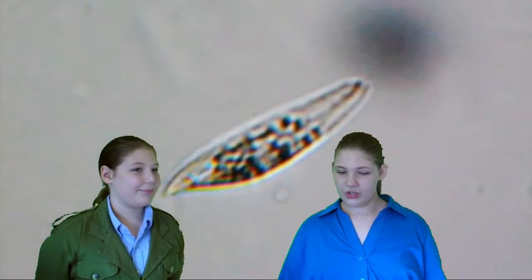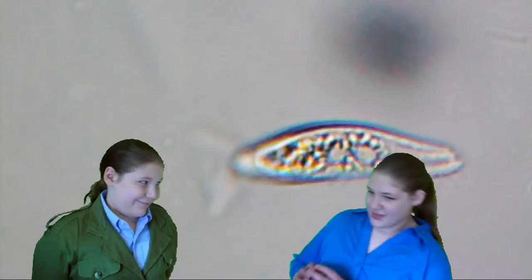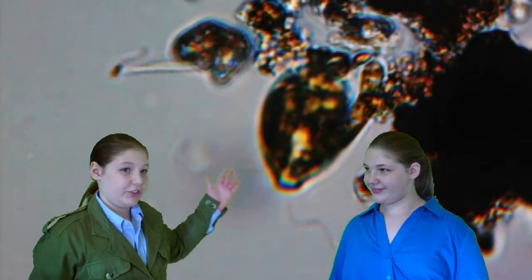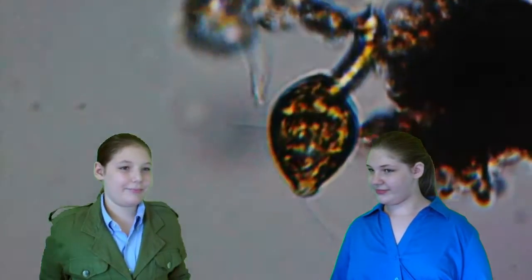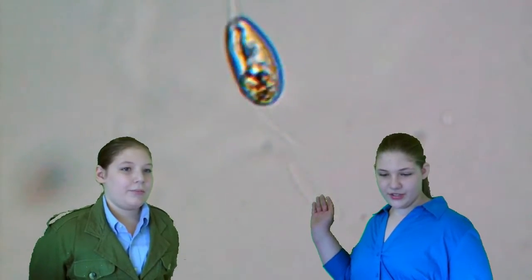We like this algae with a flagellum because we could see its central vacuole, nucleus, and chloroplasts. Look at the cilia on this. As it glides past, we wouldn't have seen this detail without methyl cellulose to slow it down. Here we have two flagellates on screen at once. And this is an example of a cell with two flagella.